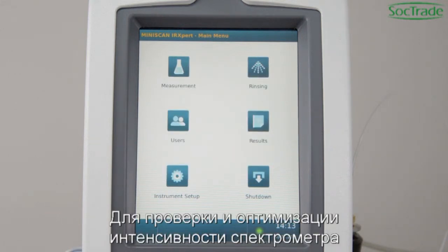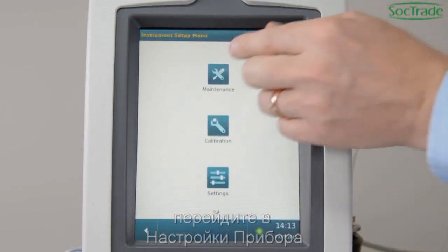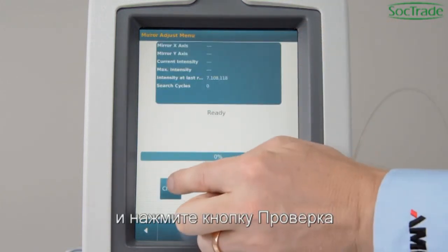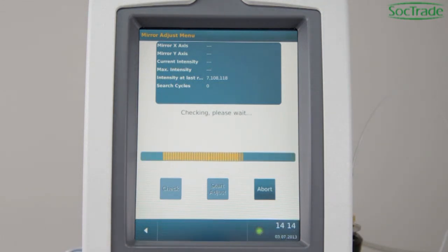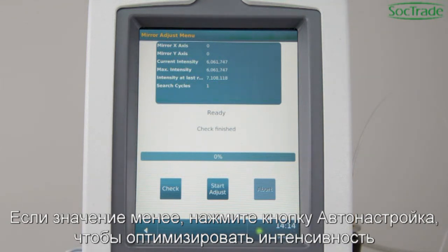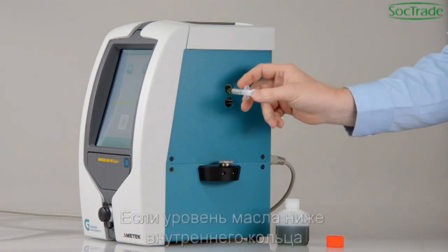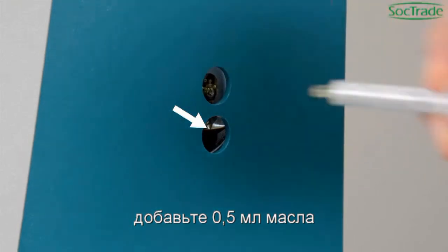To check and optimize the spectrometer intensity, go to Instrument Setup, Maintenance, Auto Adjust Mirror, and press the Check button. The resulting intensity should be higher than 4 million. If it is not, press the Auto Adjust button to optimize intensity. Check the oil level from time to time when the instrument is in idle mode. If the oil level is below the inner rim, refill 0.5 ml of oil.